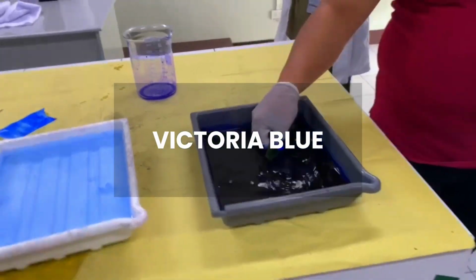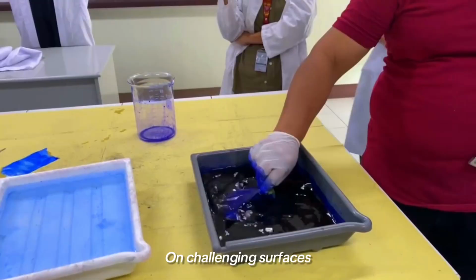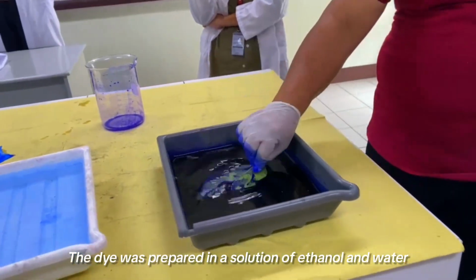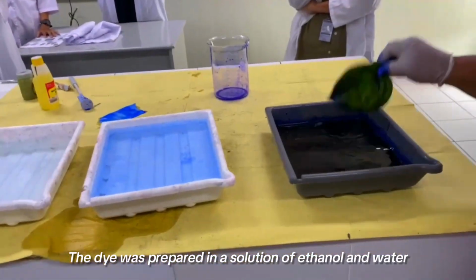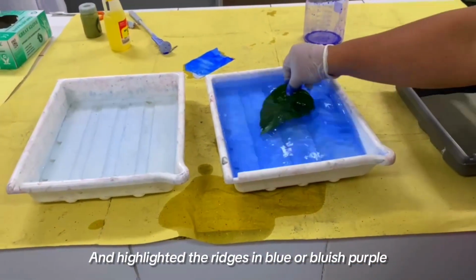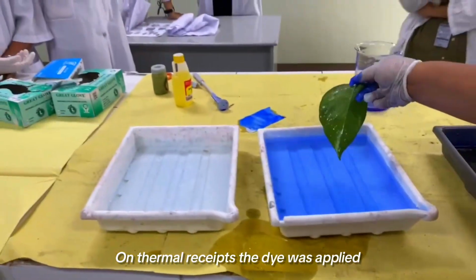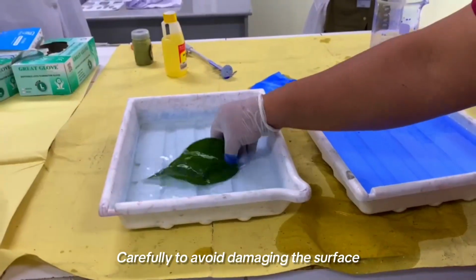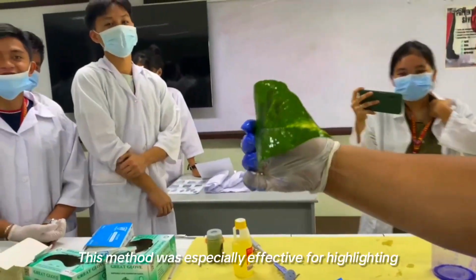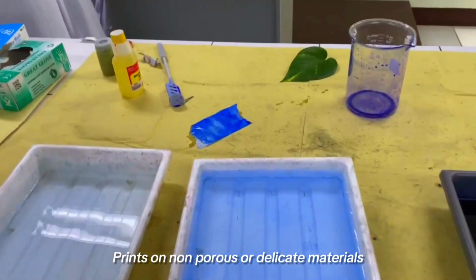Victoria Blue on leaves and receipts. We also used Victoria Blue dye to develop fingerprints on challenging surfaces such as leaves and thermal receipts. The dye was prepared in a solution of ethanol and water. On leaves, the dye adhered well to the waxy coating and highlighted the ridges in blue or bluish purple. On thermal receipts, the dye was applied carefully to avoid damaging the surface. The result was a vivid, high-contrast fingerprint image. This method was especially effective for highlighting prints on non-porous or delicate materials.